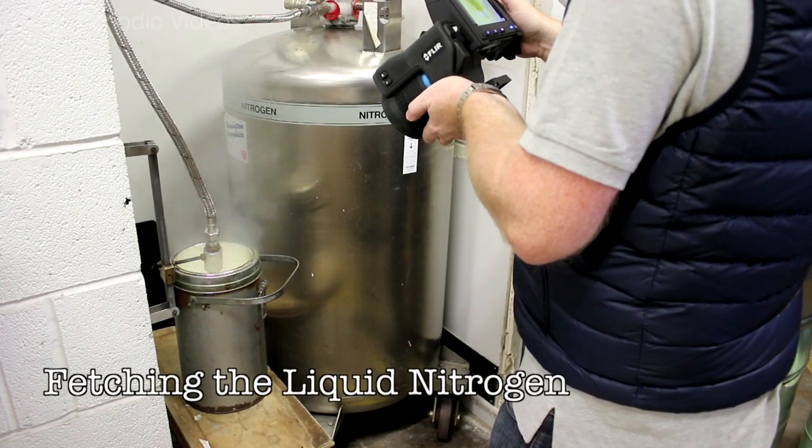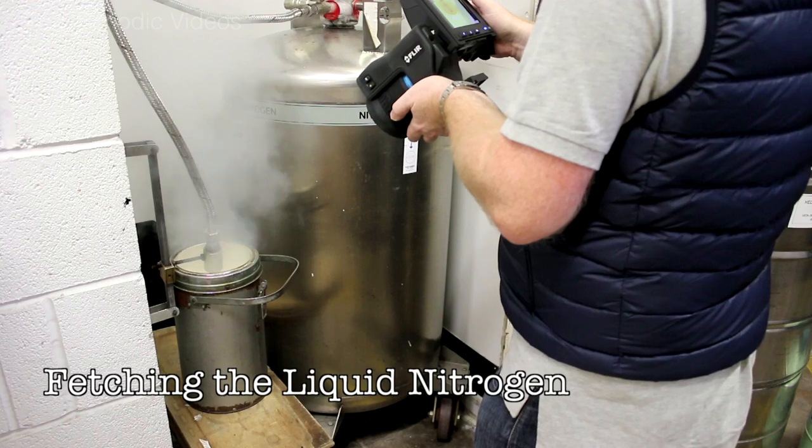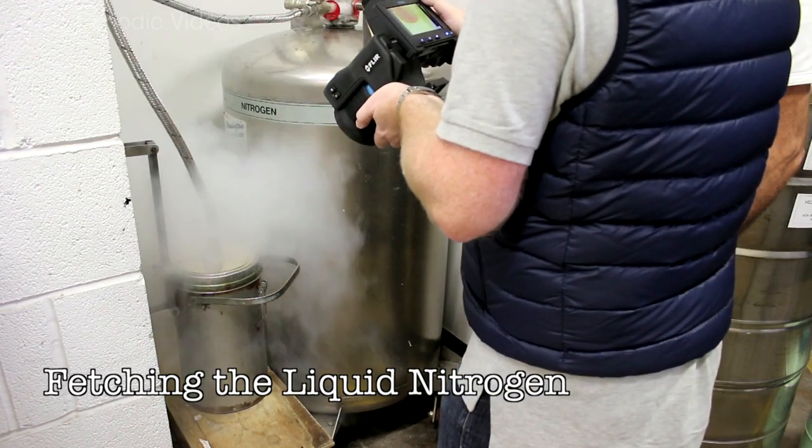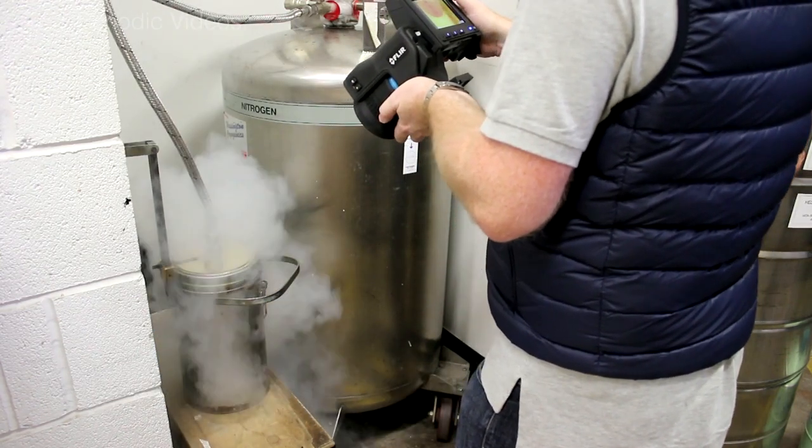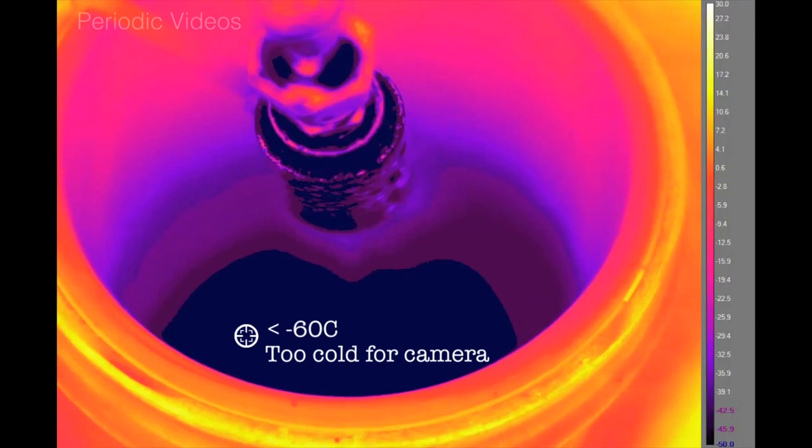The first thing is that you have to fetch some liquid nitrogen from the tank. It's usually a bit of a chore, but when you look at the temperatures, it's really quite interesting.